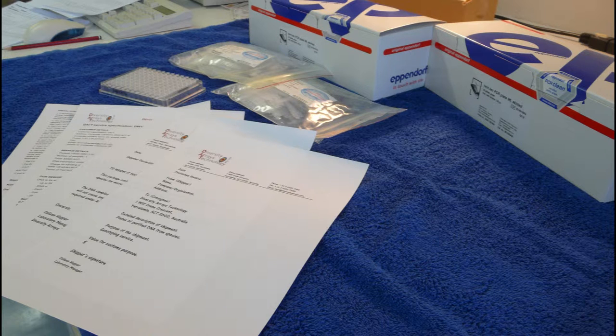In this video I will be demonstrating how to correctly pack and ship DNA. The process I will demonstrate is the most effective way to pack and ship DNA so that it arrives in optimal condition. The requirements I request will result in the safe arrival of your DNA.